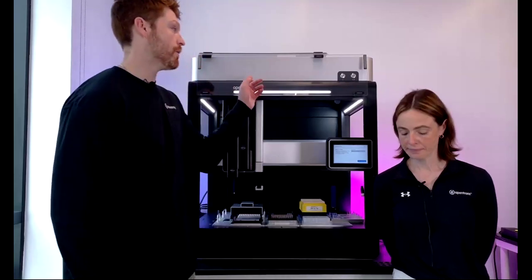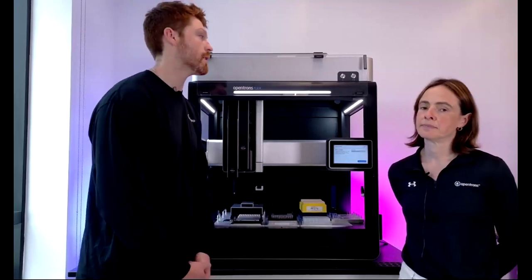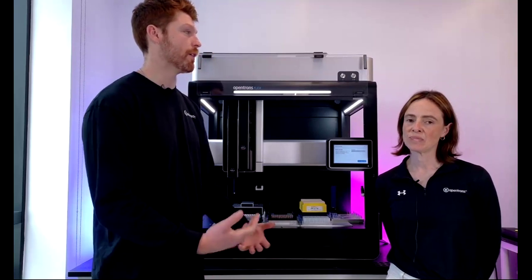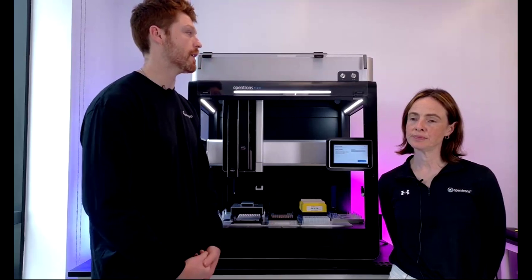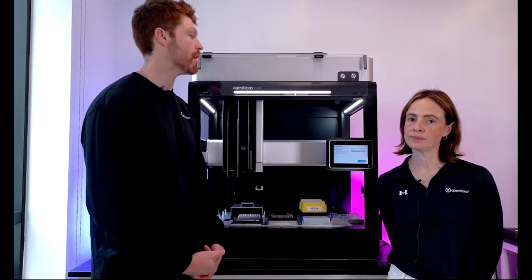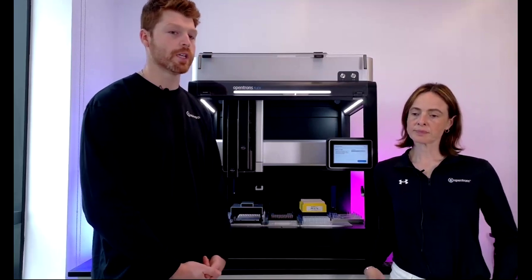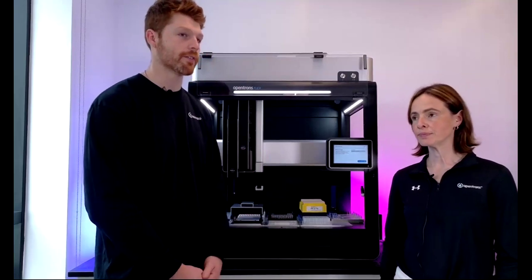Great. Can you please share more about the HEPA UV module? What applications is this most useful for? Yeah, absolutely. So the HEPA UV has two components. One is a UV light source, which goes on for 15-minute increments and is designed to sterilize the interior and the deck of the instrument. That's particularly useful in the genomic space, between PCR cycles, to ensure you're not going to carry over or cause any contamination.